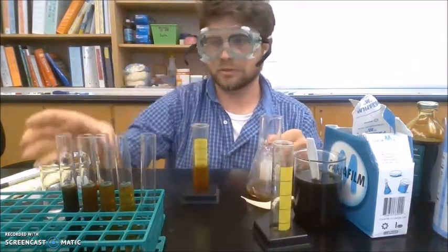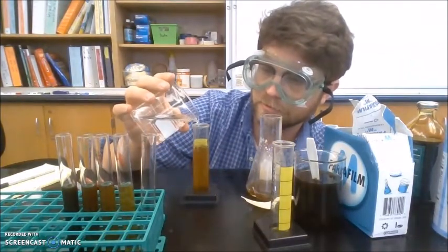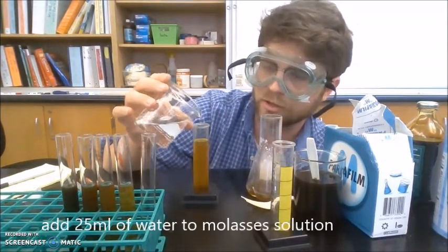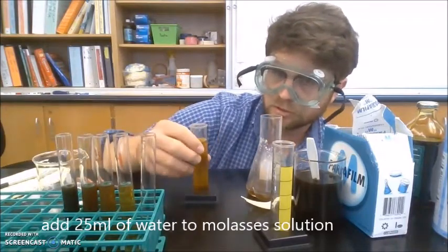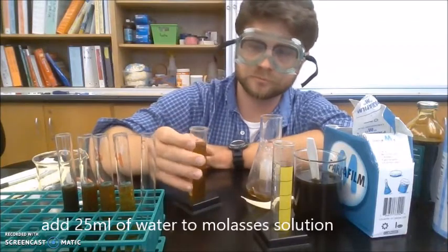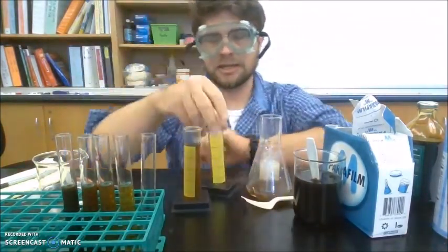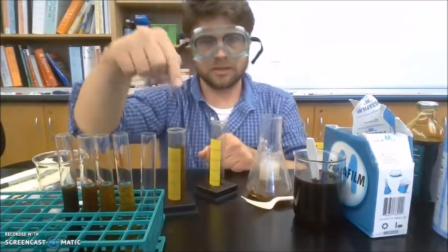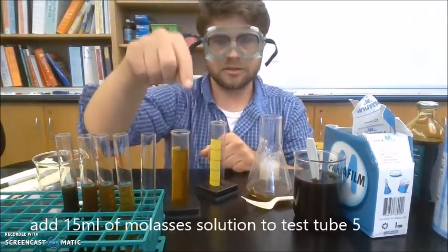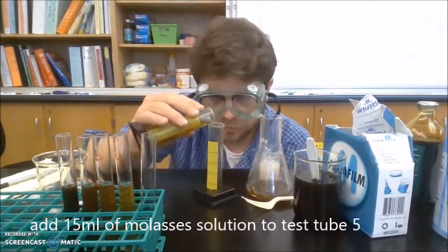And then one more time, I will add 25 milliliters of water to my molasses and water solution. And I want to add 15 milliliters of this water and molasses solution to my final test tube.